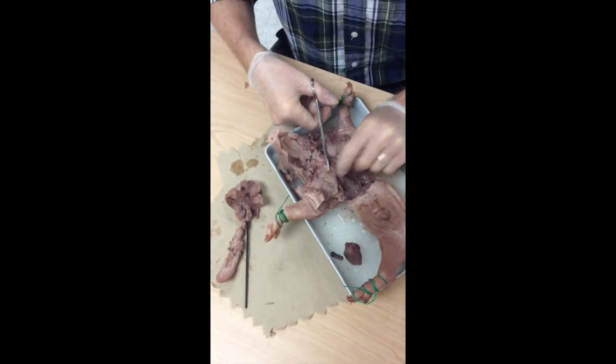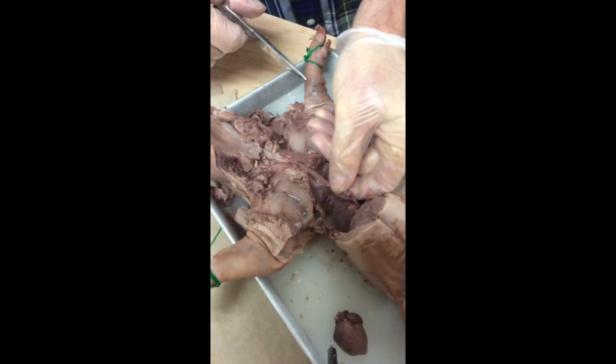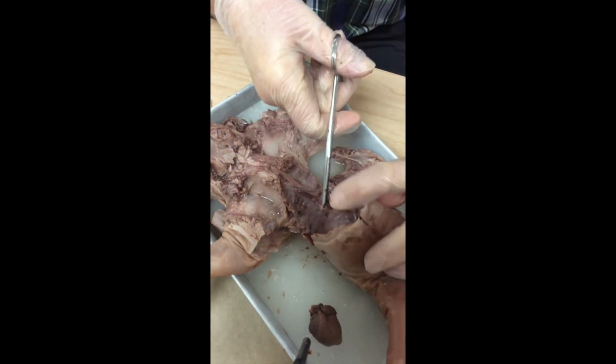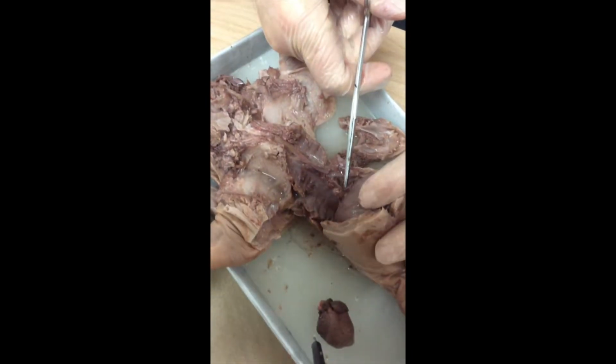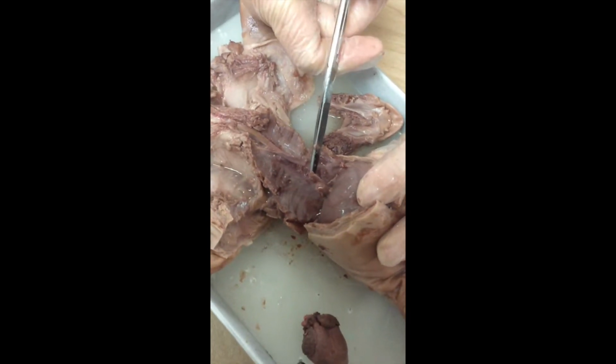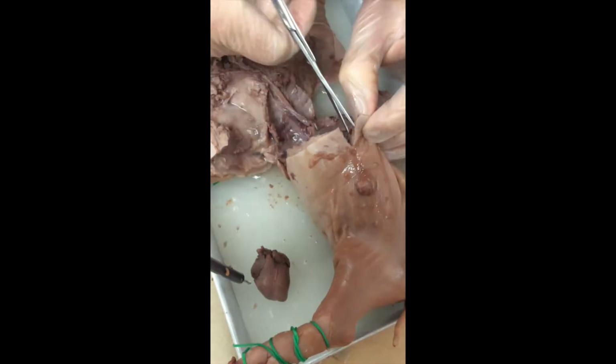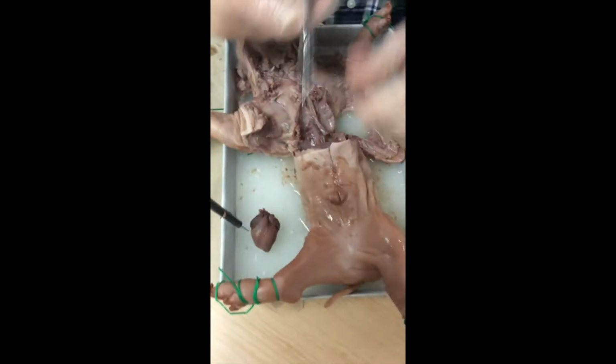Again, I goofed up. I did inadvertently cut the esophagus, which was attached right there. So that makes this the inferior vena cava. I'm squeezing on the abdominopelvic cavity, and I'm getting a little fluid coming out of the inferior vena cava, and we have the aorta down there, and the diaphragm. Let's go into the abdominopelvic cavity. I think you guys will have time to do that.